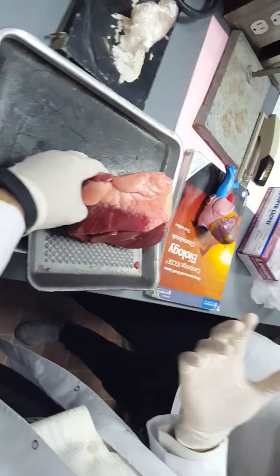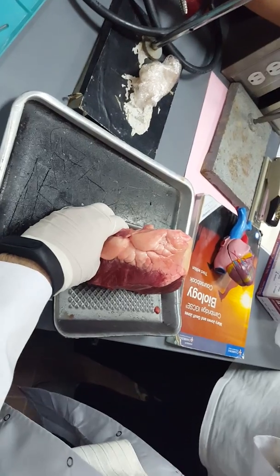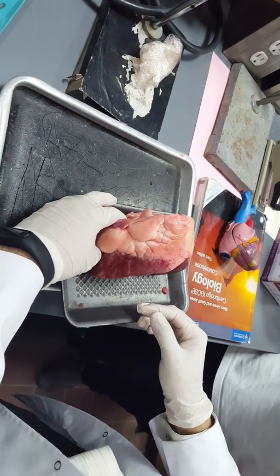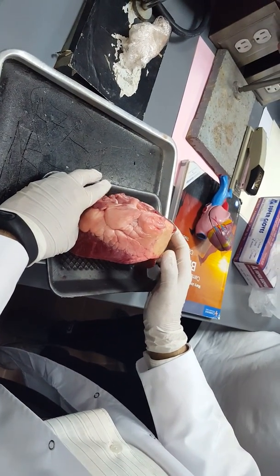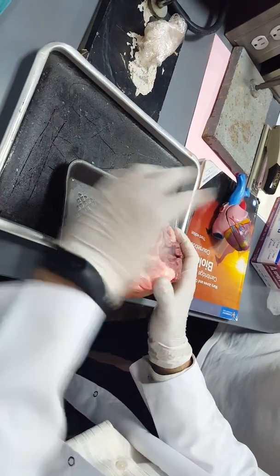Who can tell me why the atria are thin, smooth-walled, while the ventricles are strong, hard muscles? The ventricles need to provide huge pressure for the blood to move to all of the body parts, while the atria only provide pressure to move it down to the ventricles. Because the main function of the atria is to receive the blood.